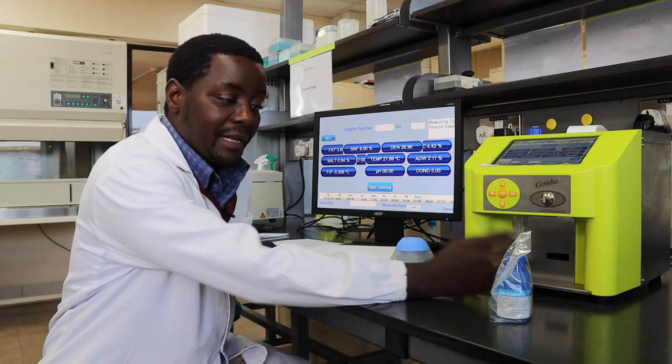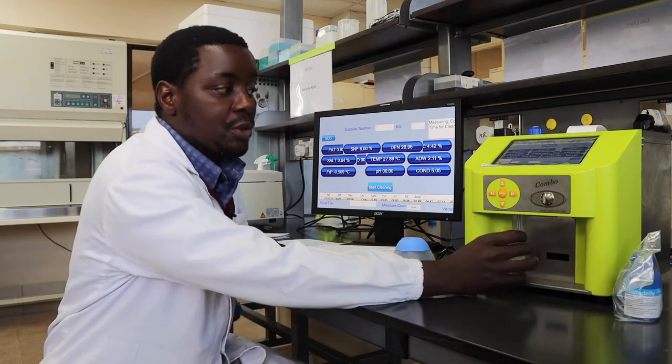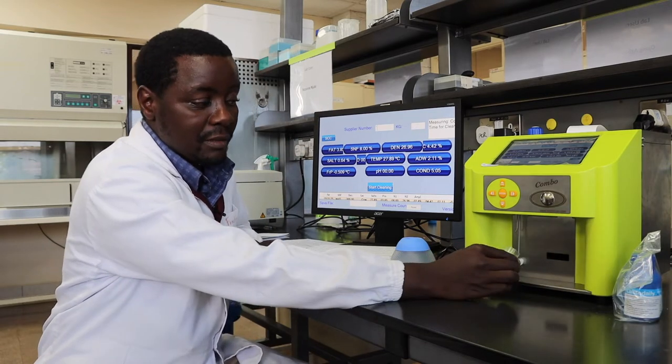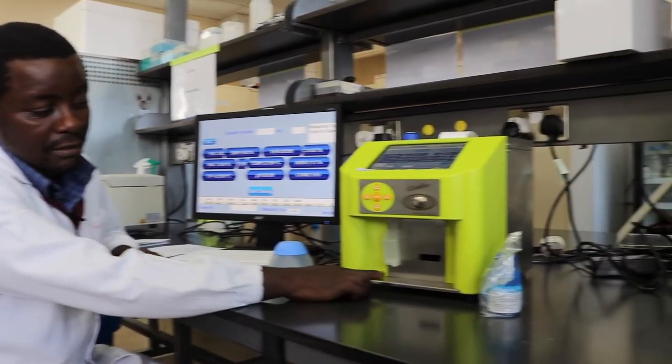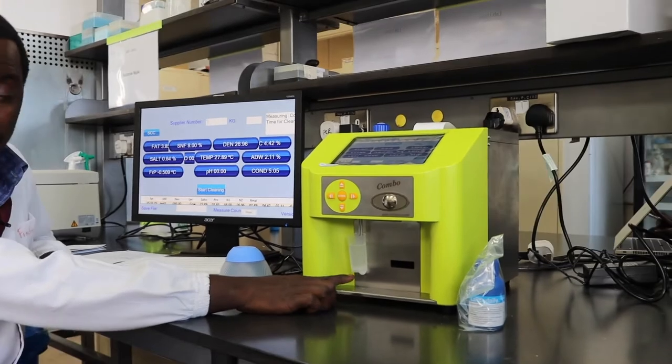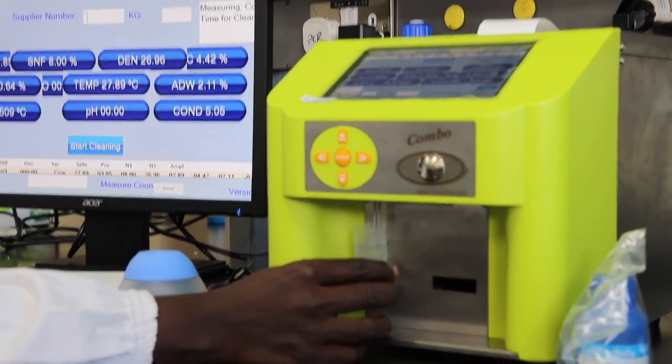Once you prepare the daily cleaning solution, you present it to the instrument recess position. Something to note is that the equipment has a mini holder which holds a mini vial.